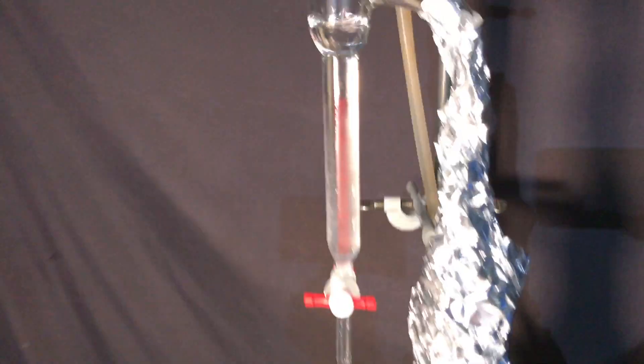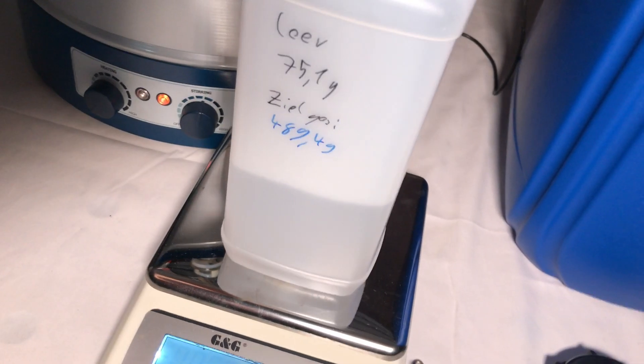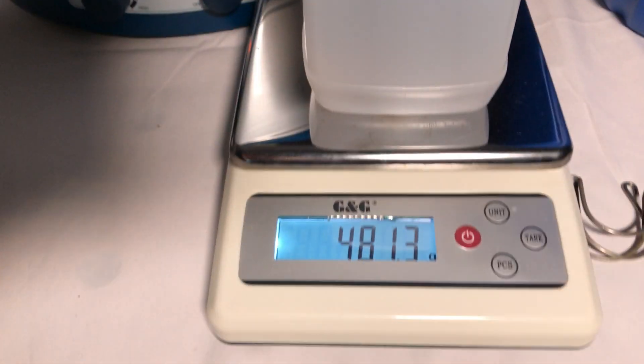Towards the end of the reaction the amount of water collected slowed down and I stopped the heating. We collected 406.2g which is 8.1g less than expected. At our scale this is perfectly acceptable.